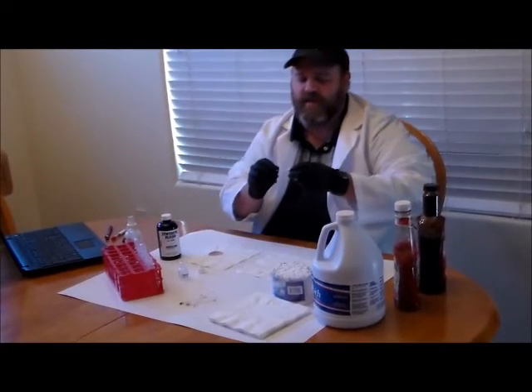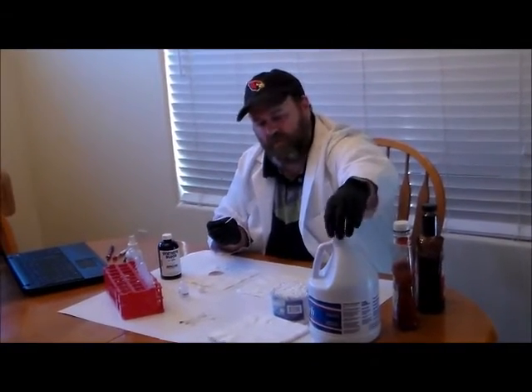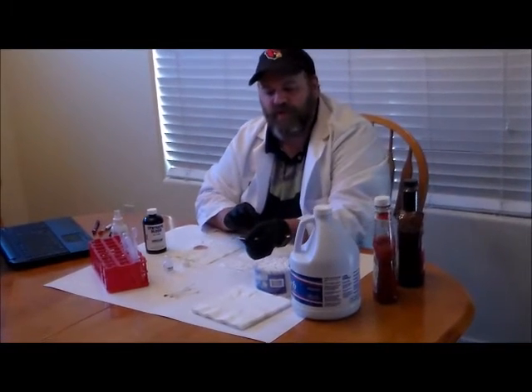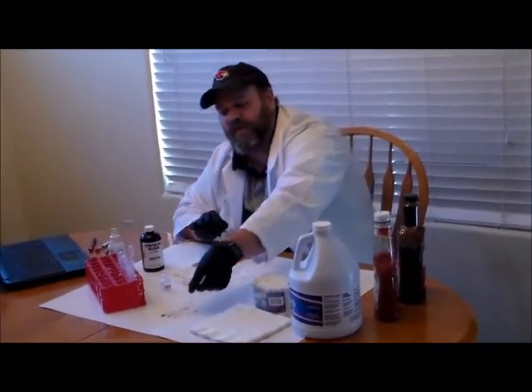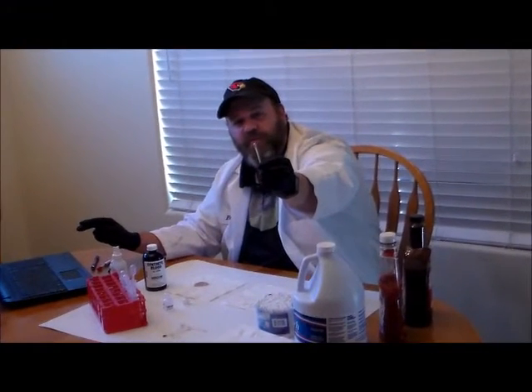Let's try the leukomalachite with the bleach. I'm going to take another swab, put a little bit of bleach on the end, and add a couple of drops of leukomalachite — remember, I don't need the alcohol for the leukomalachite. We're looking for a greenish-blue color this time. And wow, we see almost right away a formation of the bluish-green color. So bleach certainly is not blood, but bleach gives us what we call a false positive. If there was a blood stain and someone cleaned it with bleach, then we tested that area, it would actually test positive — but it might be the bleach, not the blood. Bleach gives a positive for both leukomalachite and phenolphthalein.